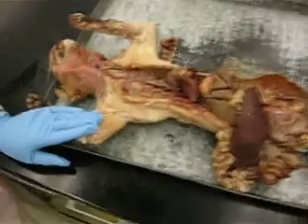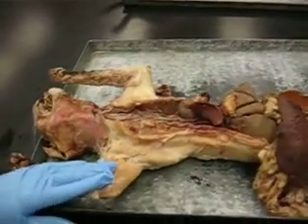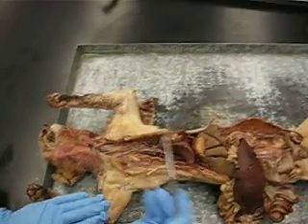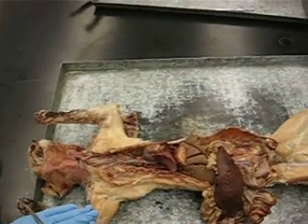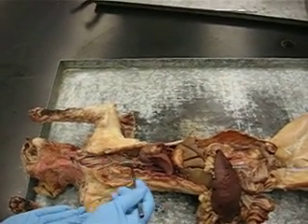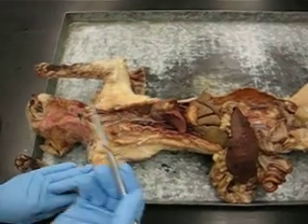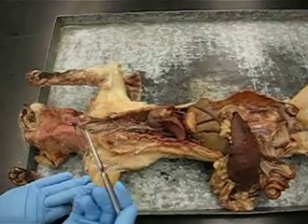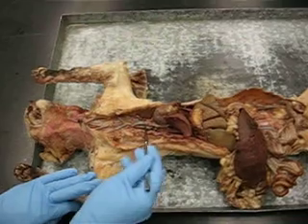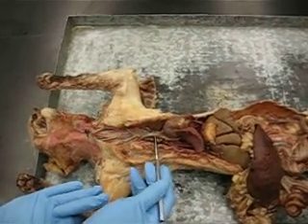You need to come closer — she's not going to be able to see. Okay, let's do it again. You need to be aggressive and squeeze in so you can see. Because I've repeated this a hundred times already, and by the time we get to this point in class, I start making mistakes, you know, and start saying the blood vessels wrong.